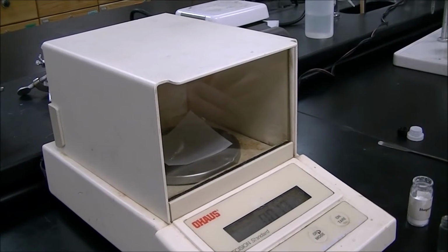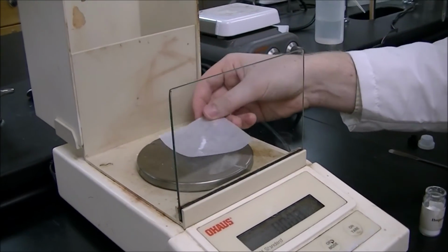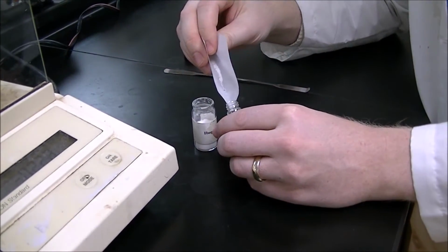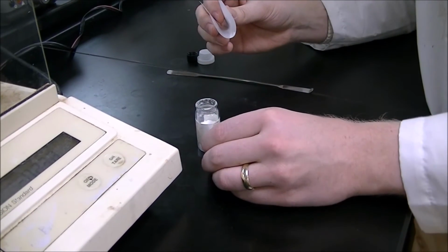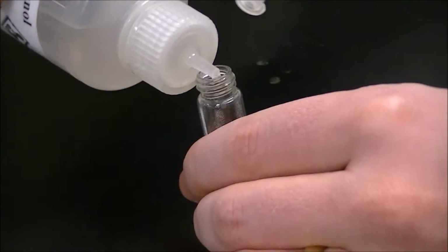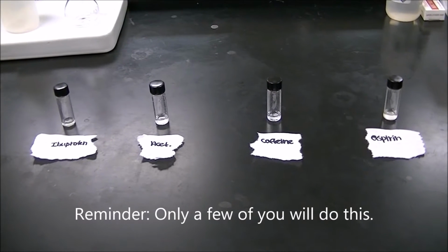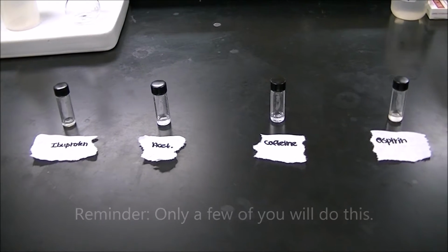Weigh approximately 10 milligrams of each known compound and transfer the compound to their individual screw cap vials. To each of the known compounds, add a few drops of methanol to dissolve the compound. Take a piece of paper and label each known compound. Place the vial next to the corresponding compound.